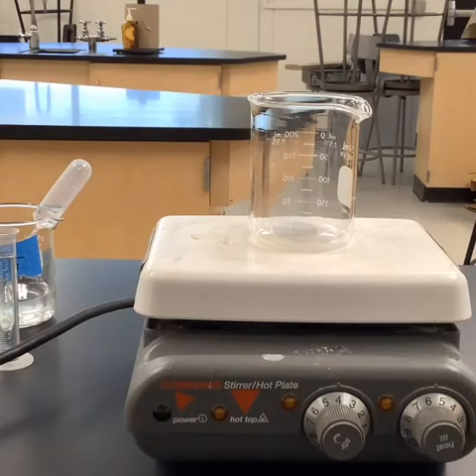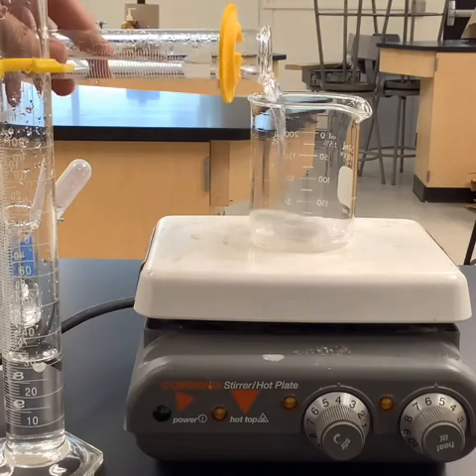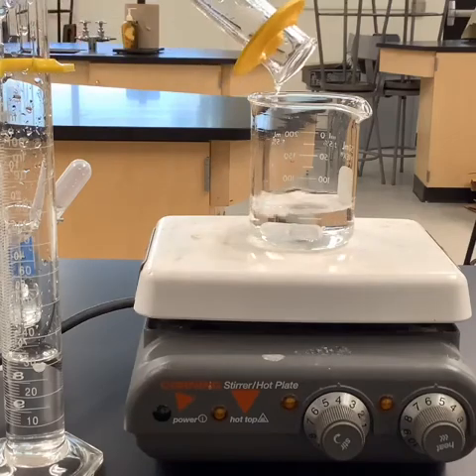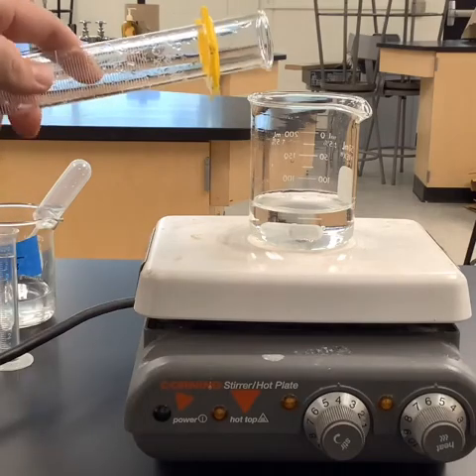We are now into our third and final trial. So remember, guys, this time we have 30 of the iodate. That's the largest amount in the 100 milliliters that we've had so far. So we should expect this one, having the highest concentration, to go the fastest. So we want to be ready for that color change. But for the sake of consistency, I'm just going to put the water in first. I've reduced the water in this particular trial to 60 milliliters, and I have 30 of the iodate. So we're going to go ahead and put that in.